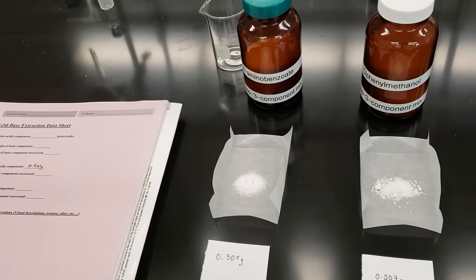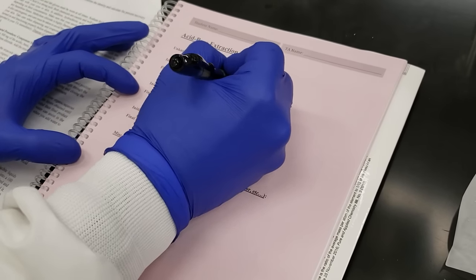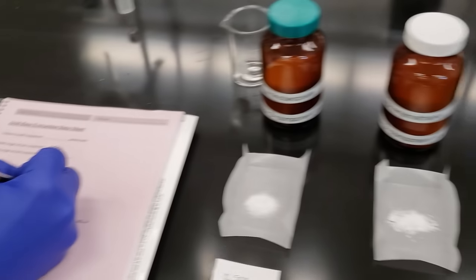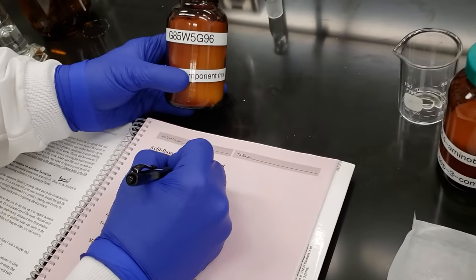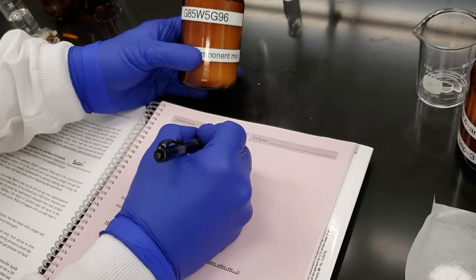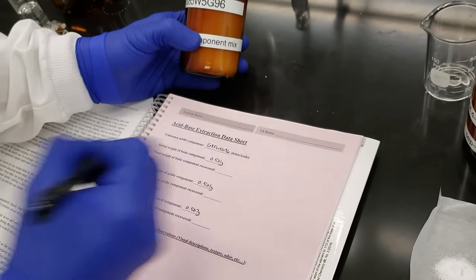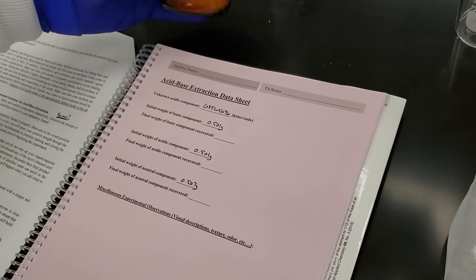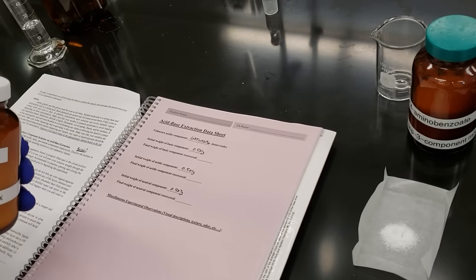For my basic component, we've got 0.501 grams, and for my neutral component, 0.507 grams. I'm going to write out my unknown code: G85, W5, G96. That's what we're going to identify after all is said and done at the end of our experiment. We're going to take these three powders, mix them in a beaker, dissolve them in methylene chloride, and then put them into our separatory funnel.